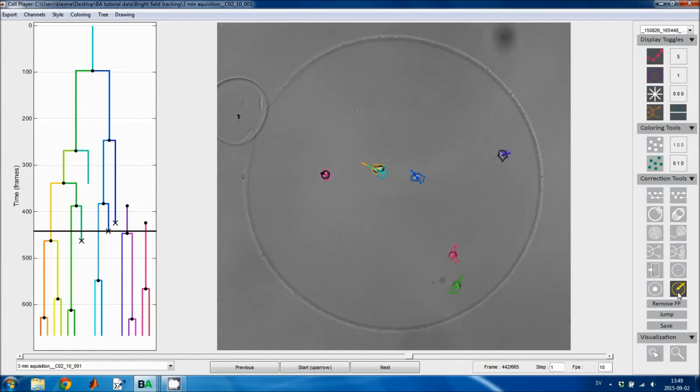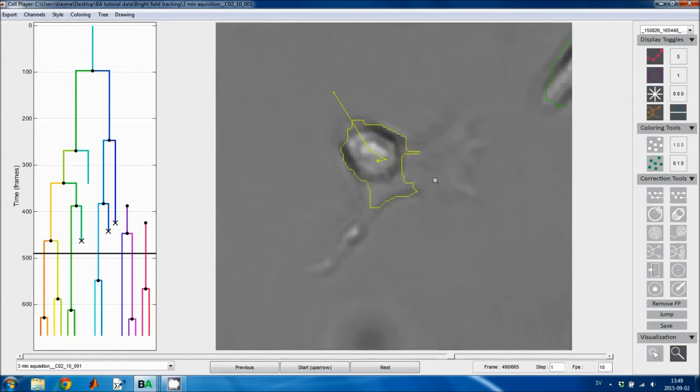This next tool is for segmentation editing, and that's something you can use if you want to change the morphology of a cell. I'm gonna make a dedicated tutorial about this, so I'm only gonna go through it briefly. Here we can see that the outline of this cell is not correct, so we can use this tool to change it. And it's just a paintbrush where you either paint more cell or you erase cell.